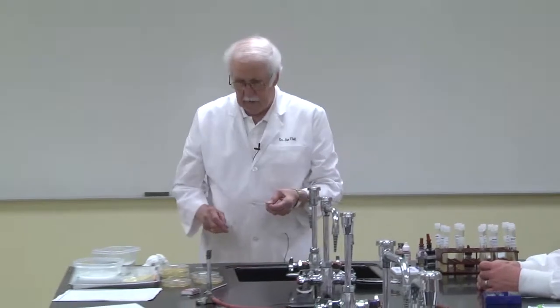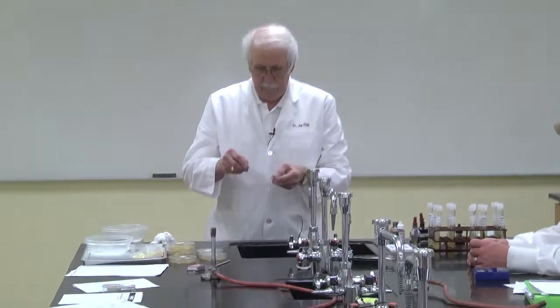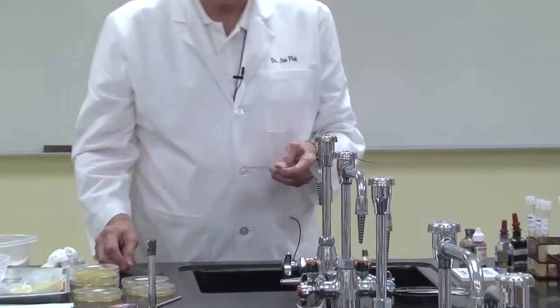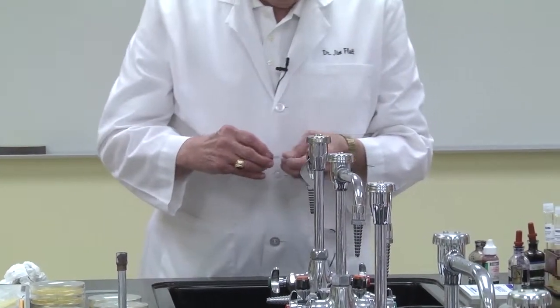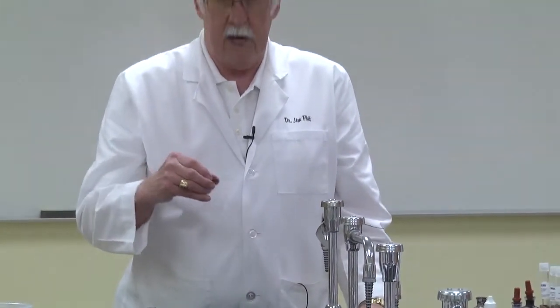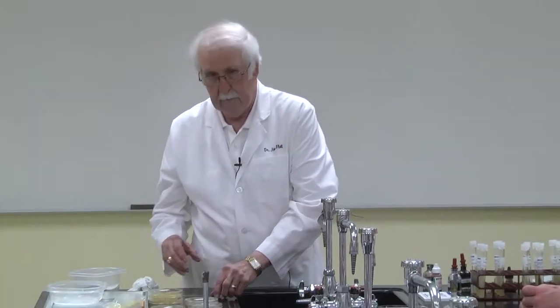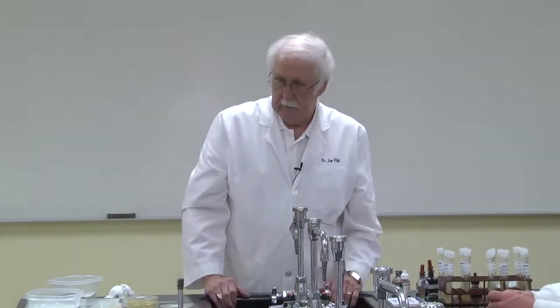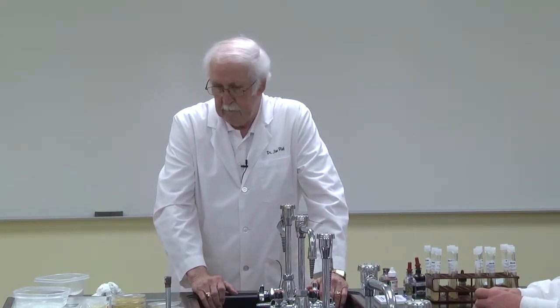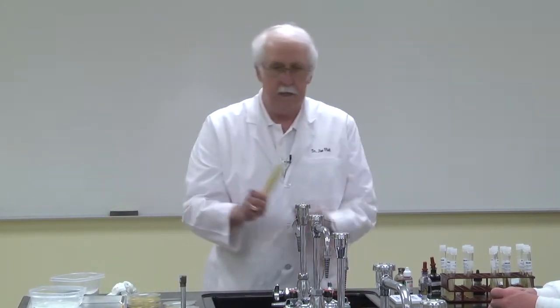These are highly corrosive. We take a second slide now, put it in front of that, push that forward and bring it back, and we let that air dry. With that, we can determine the size, the shape, and the arrangement. Normally, we would be using the Bunsen burners to kill the bacteria, since we can use those over and over again, but this is very convenient here.